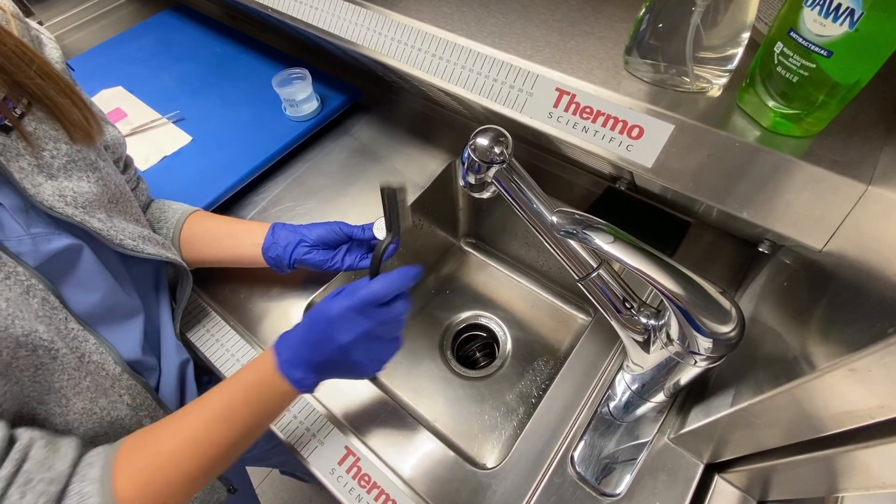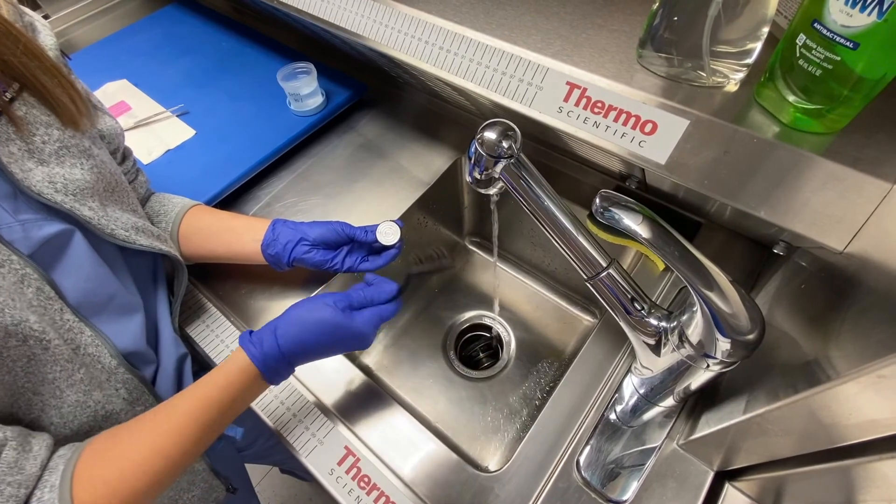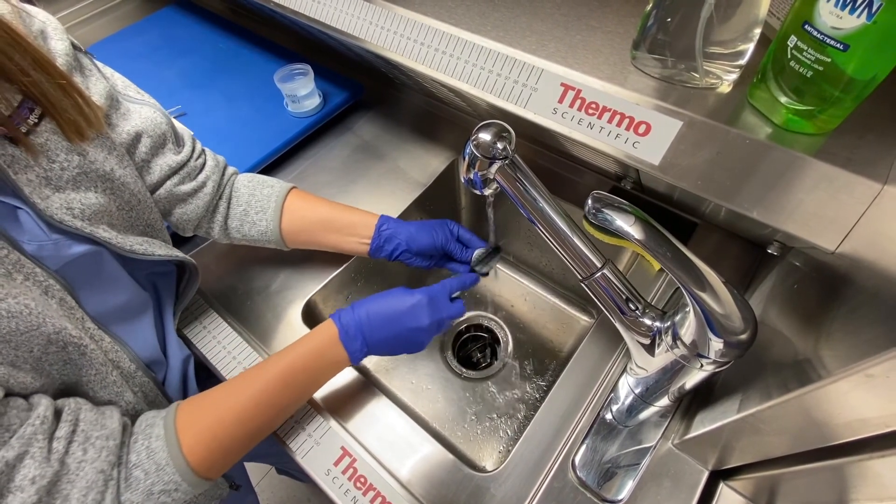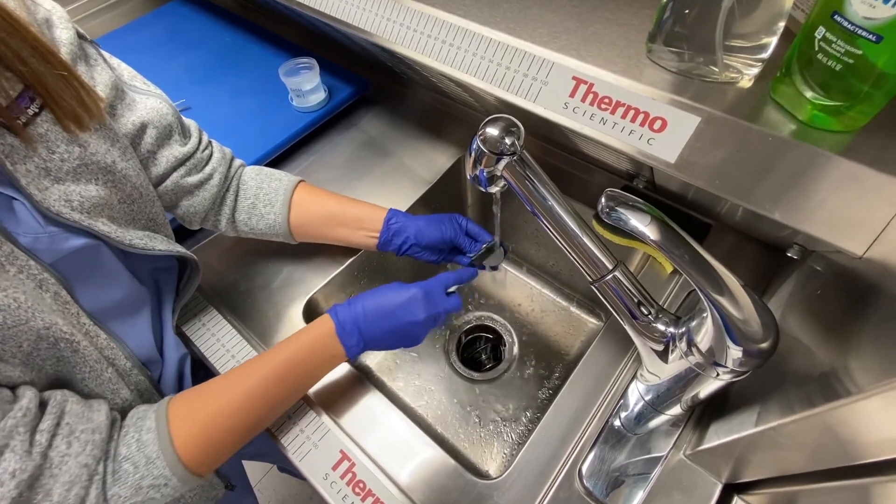When going to clean your chuck, make sure that you use a bristle brush to get in the grooves, in addition to water, to scrub all of the excess OCT out.